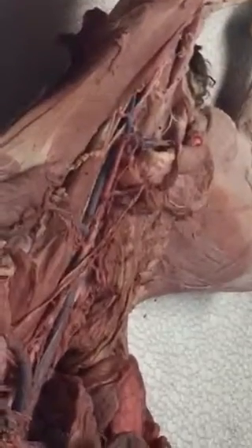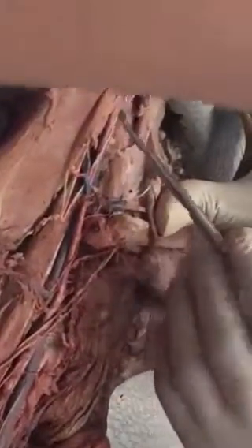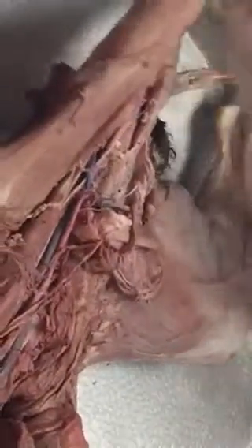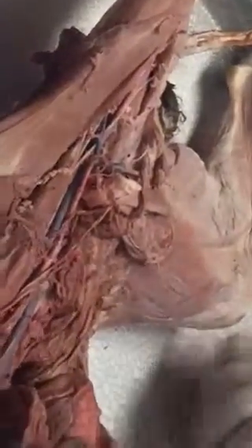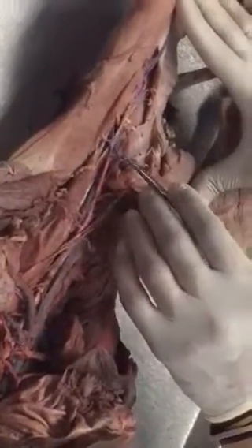All right. Is there a point where like it's defined or no? For the femoral? I believe it's, don't quote me on this, but I believe it's after this branch right here. But don't worry, if I was gonna pin it on a test, it would be like something where you could be like, that has to be the femoral, or it would be like right after the internal iliac, so you know it has to be the external, it can't be the femoral.